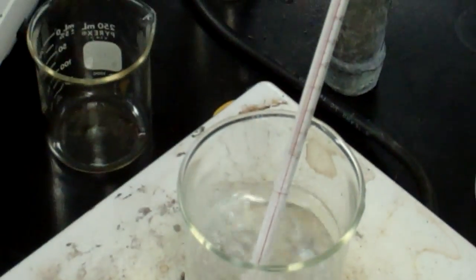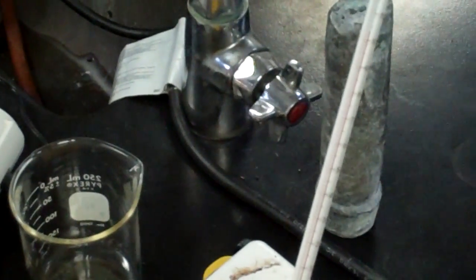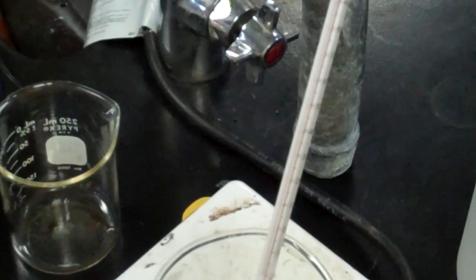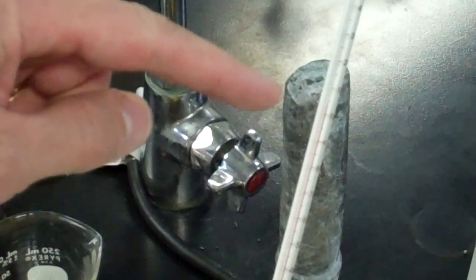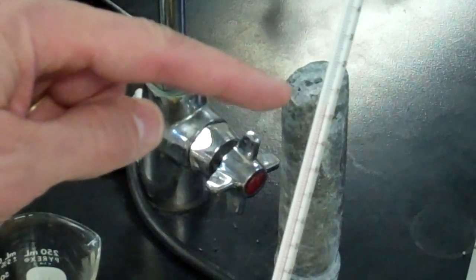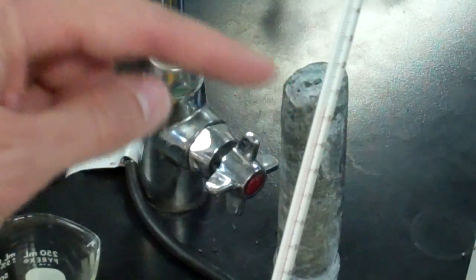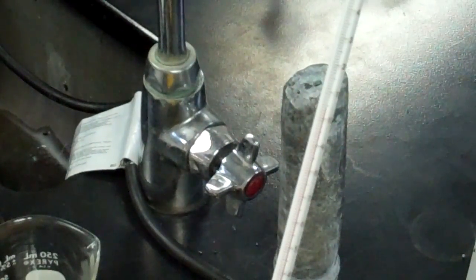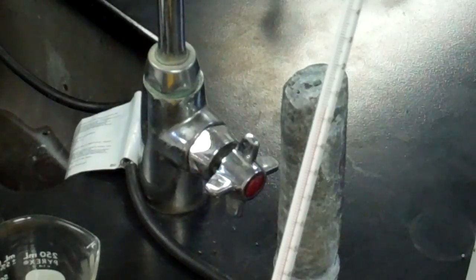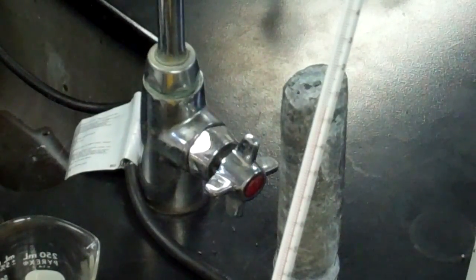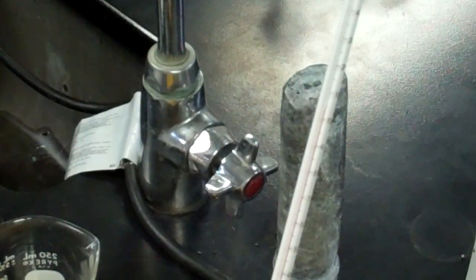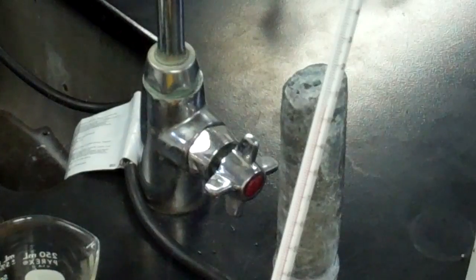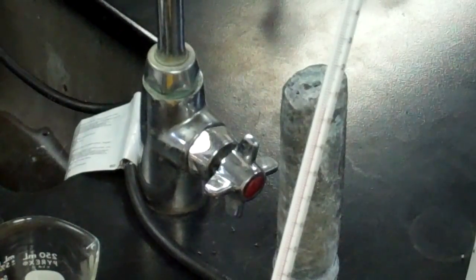Okay, let's see if I can zoom in on that. We'll see what our final temperature is. It's about as close as we're going to get. So I'm going to have to read that for you, I'm afraid. Let's see where we're at. We're at about 104. I'm trying to get to the nearest tenth. It's actually right on 104 degrees. Maybe just a tad over 104. So obviously that's a bit higher than the boiling point that we had before we had the salt dissolved in there.